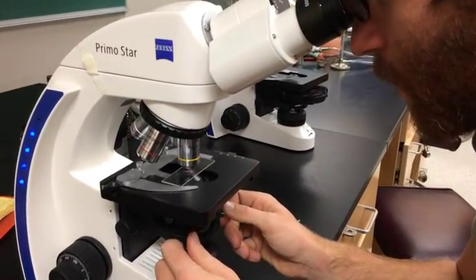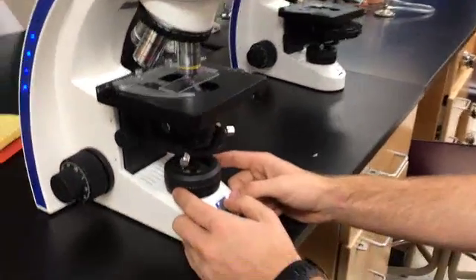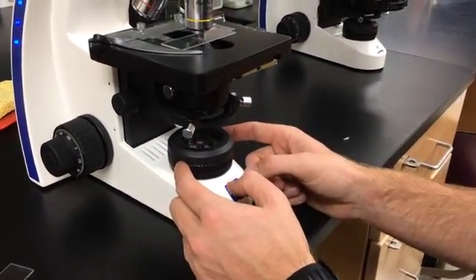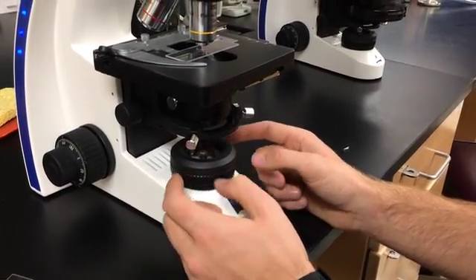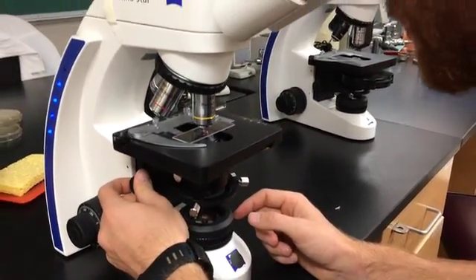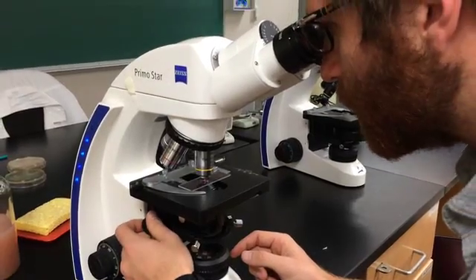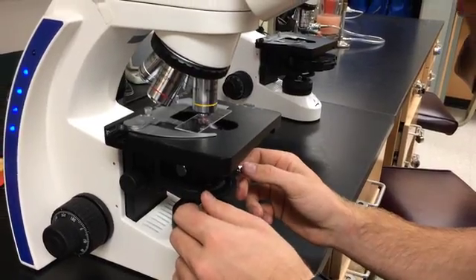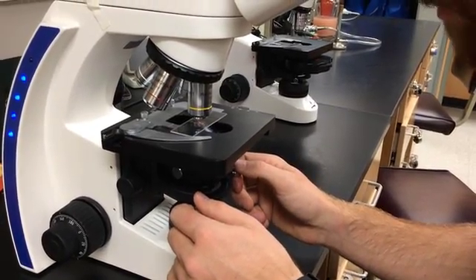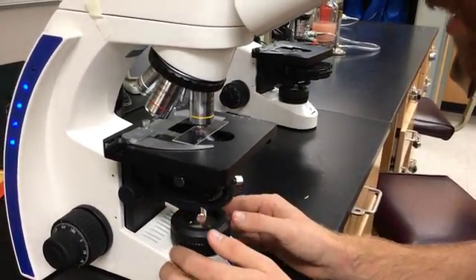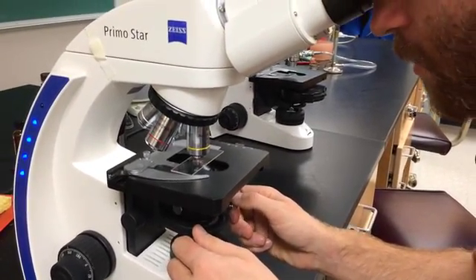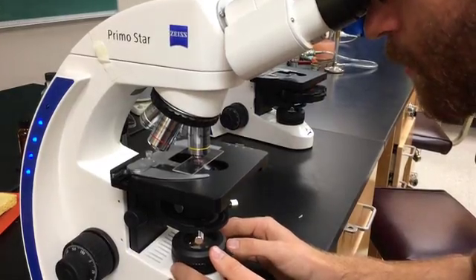Just about. And now I'm going to open it up, make that image bigger using this lamp diaphragm. And it looks pretty good. I think I need to focus it just a little bit more. Okay, it's sharper now. I've got corners. I've got sharp edges to that. It actually looks like a decagon. It's got like 12 sides. It's still fairly centered. I did a good job centering it. But I can kind of rework it to just make it a little bit more perfect. Open it a little bit more.